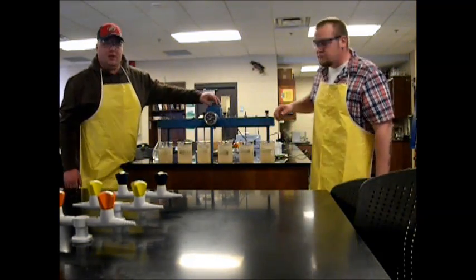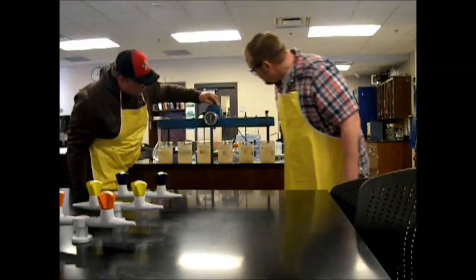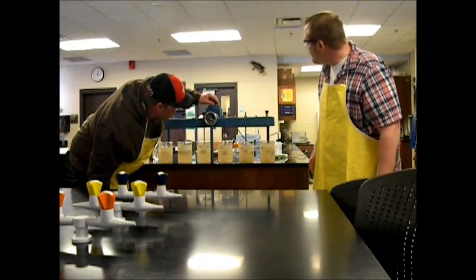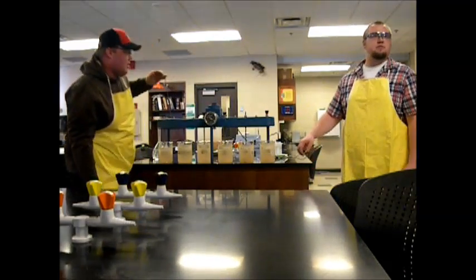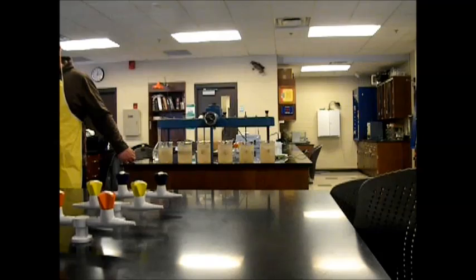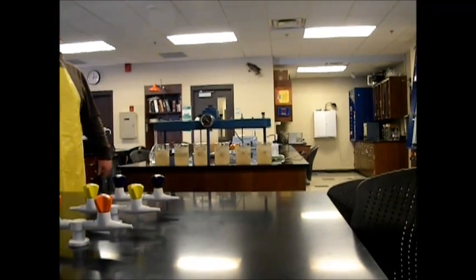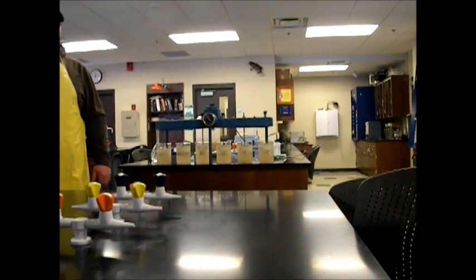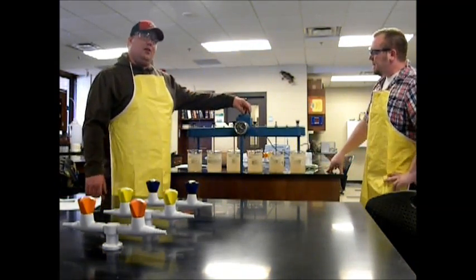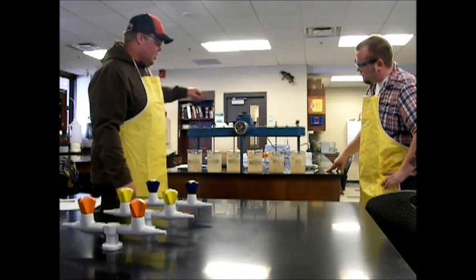Now we will slow it down to 30 RPM. This is now representing the flocculation mixer, and this is going to go for 15 minutes. Now our 15 minutes are up of our flocculation process. We can go ahead and turn this off.